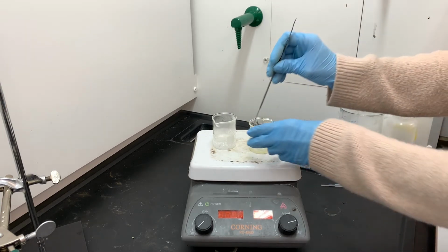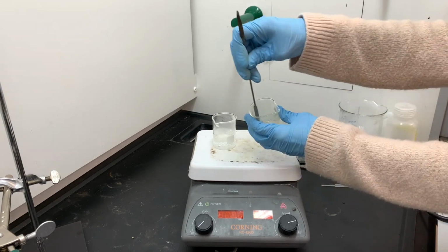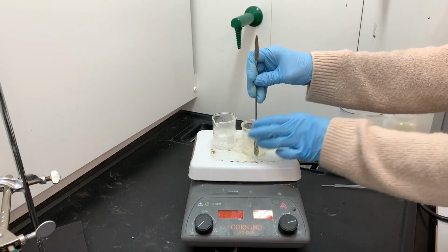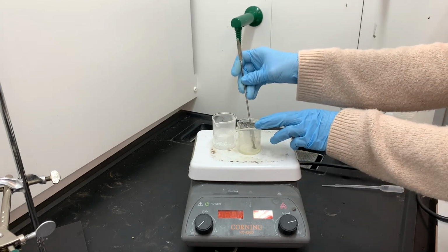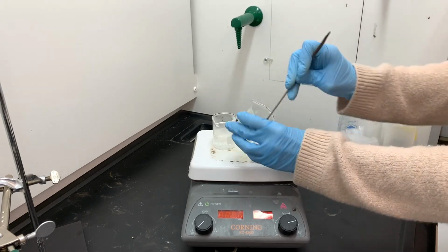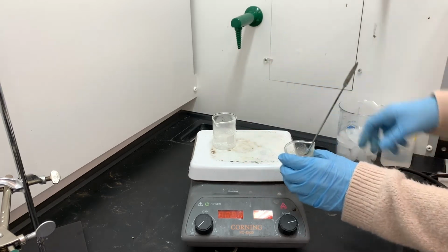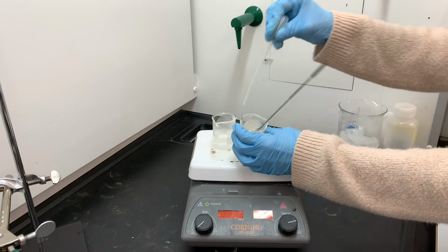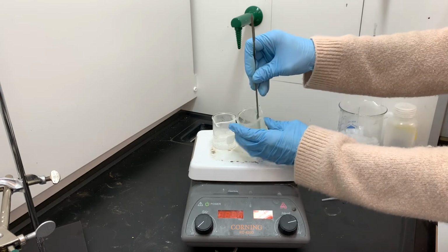Then I'm going to be using the metal spatula as a way of stirring, and this is the same metal spatula that I scraped the beaker with in the last part of the video, so this has got product on it as well. So this is dissolving a little bit of the product off of the metal spatula. I'm scraping everything down, trying to get it down into the liquid. Remember that we don't want to add too much water or solvent during the recrystallization process, so even though I have only a small amount of water in here, I don't want to add more water until I feel that it's really necessary. Again, using the water to rinse down the side of the beaker to help get everything rinsed from the beaker and dissolved in this hot water.